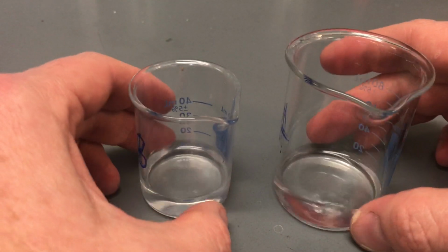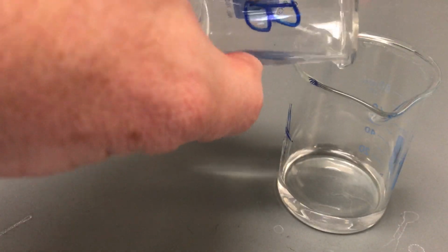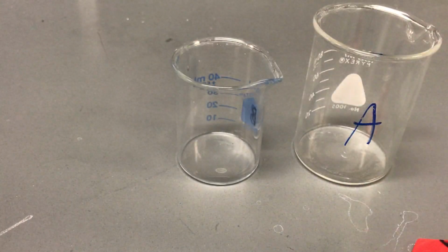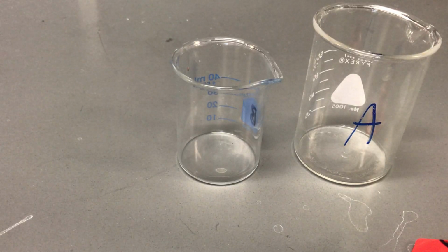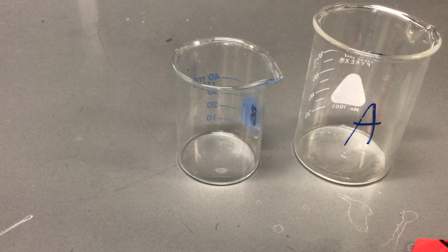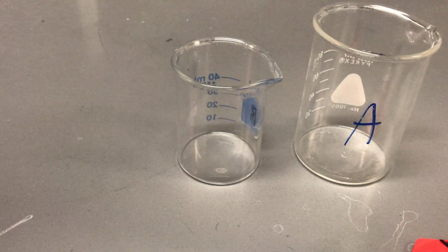And here we go. So get ready to press your start and your stop. Again, as soon as the liquid hits, start and then stop at the color change. There we go. And then finally, our last round, I only have 2 milliliters in there, and it's going to be 8 water. So this is a 20% solution on this side, where we started out again with 100, and then we went to 80, then to 60, then to 40, and now we're at 20. So we have one more trial to go here, and then you can answer your questions as appropriate.